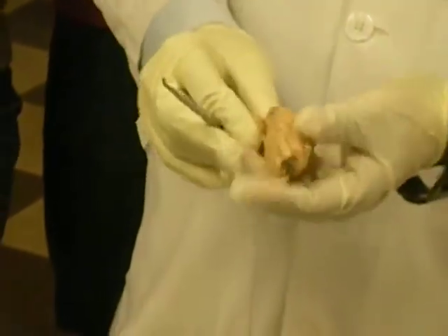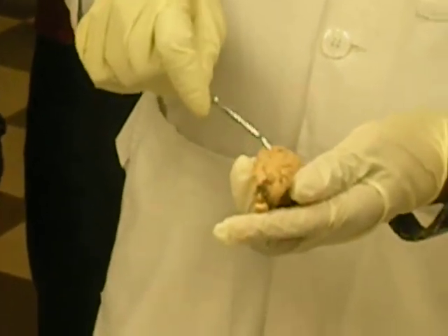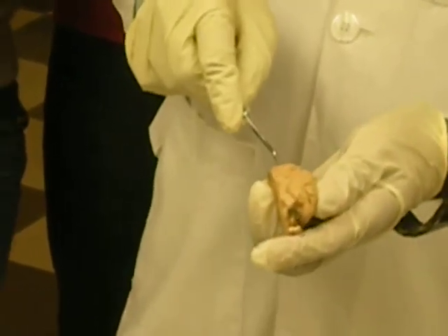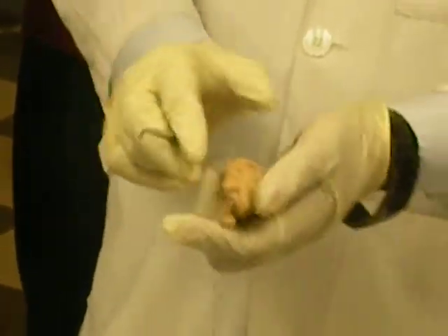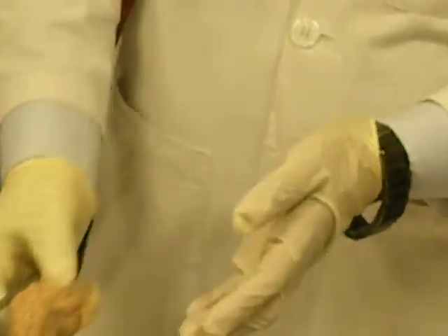So what we are going to do now, we are cutting it open. We will make one deep cut through this line. Don't go up to this, open it like a book, alright? Keep those things attached. And now I'm going to show you the inside stuff, alright?